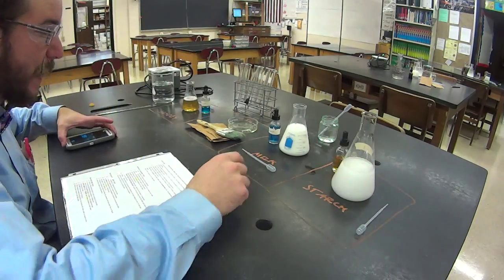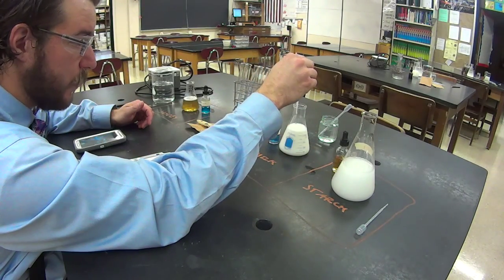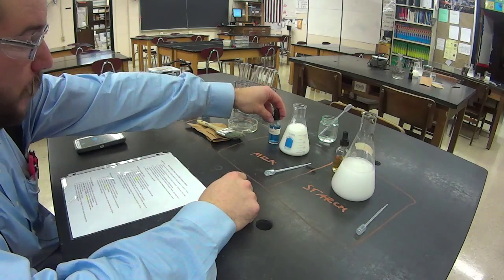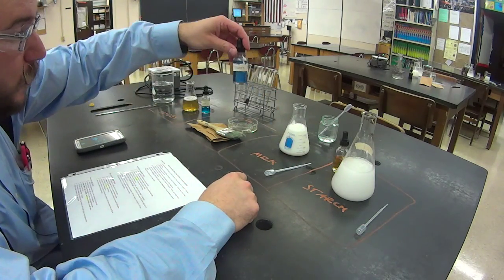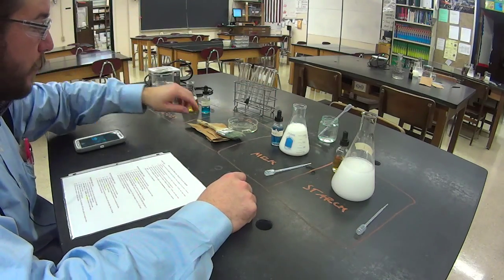You got milk. Here's some powdered milk. Wouldn't recommend drinking it. It's pretty gross. Use that to test for polypeptides, for proteins. Use the Biuret reagent with that. And again, when you're done, everything back in the milk box.